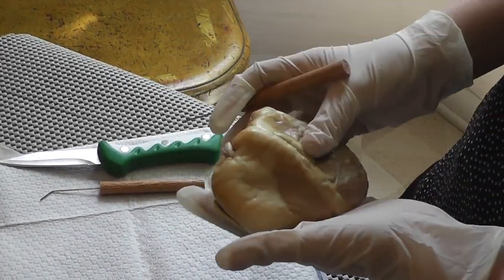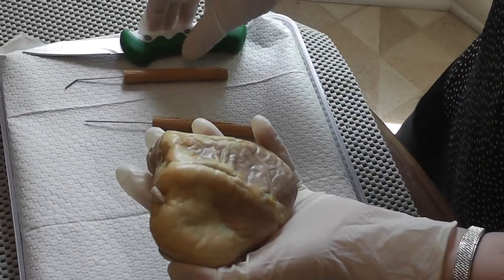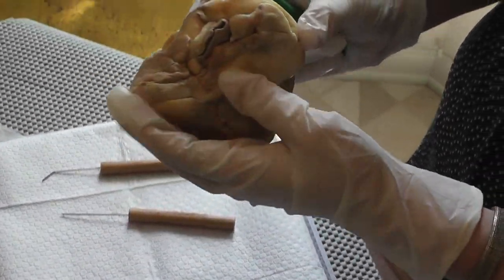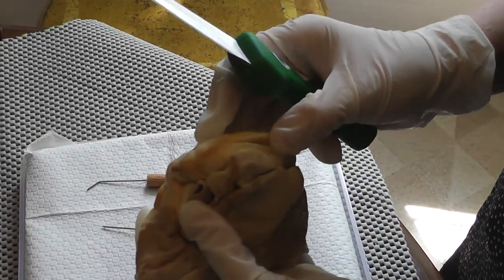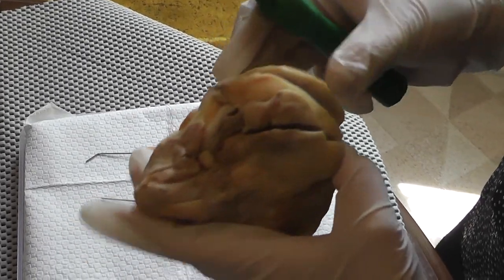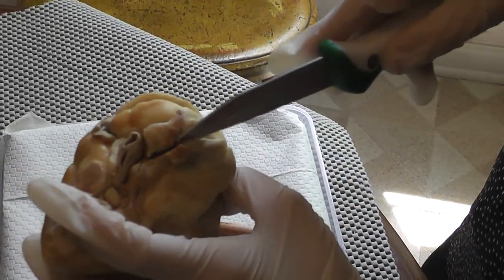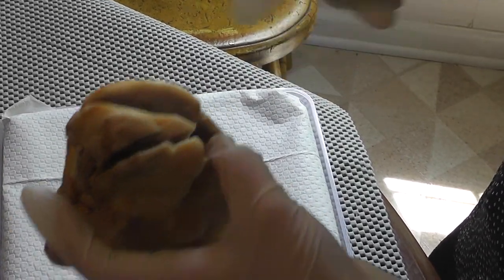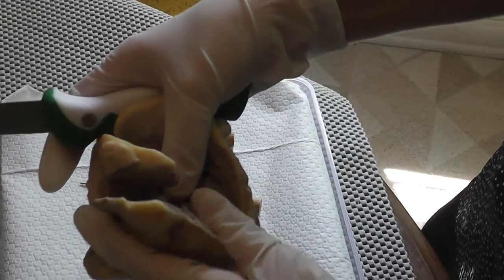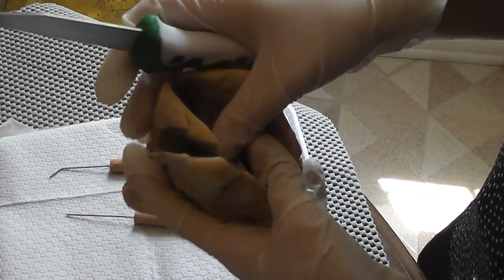So now let's go back to the ventral side of the heart. I've already started to dissect the heart. Let me first take a look at the right chambers of the heart. What I did was I cut through the pulmonary trunk, and I also cut through the vena cava over here, and I met these two cuts. This opens up the right chamber of the heart.